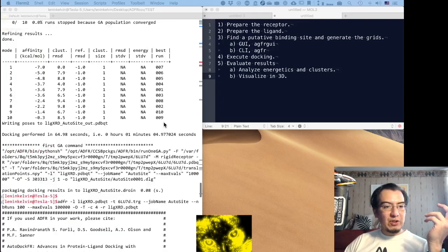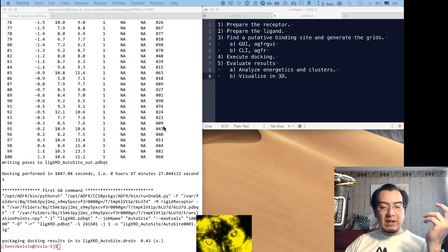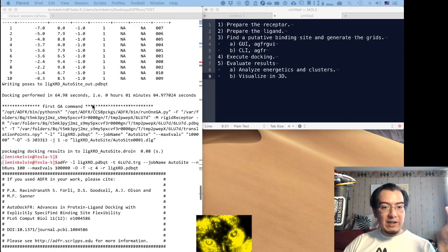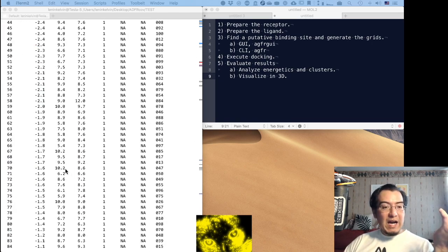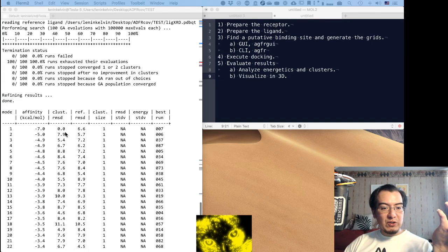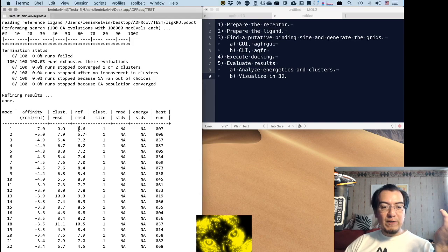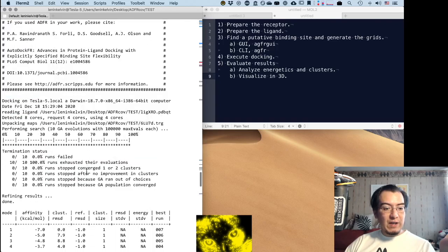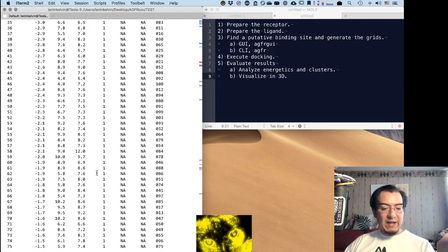This clearly shows that this probably should be run in a computational cluster, or at least not the four cores that I have locally, and increase the number of evaluations. Even 100 runs with 100,000 evaluations is not enough. I think we got a very similar result. Now we do have this reference RMSD because we gave the original file, and they are pretty far away, which also might be a consequence of having just very few energetic evaluations.